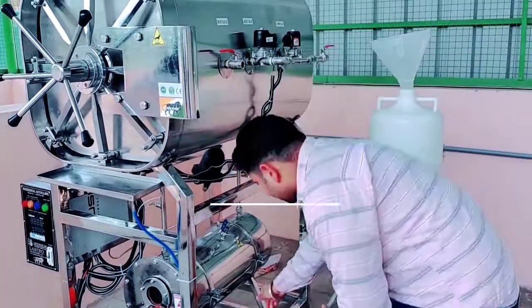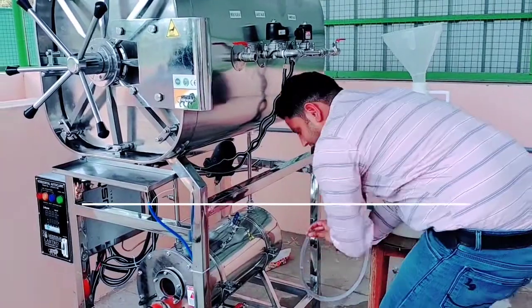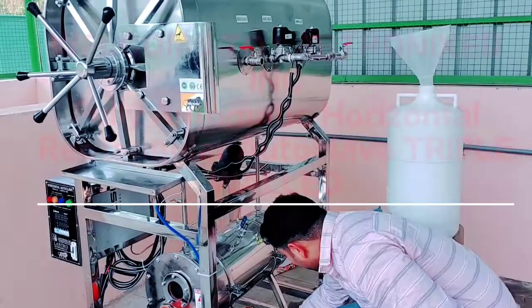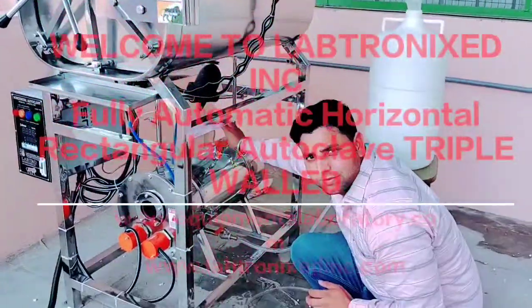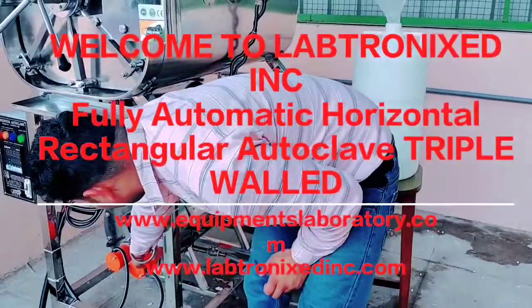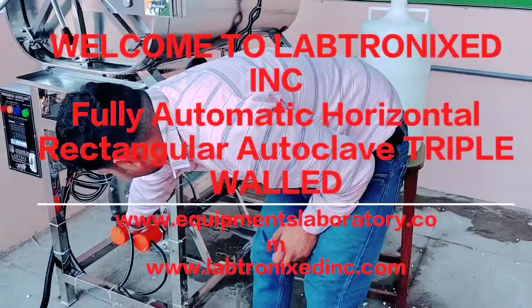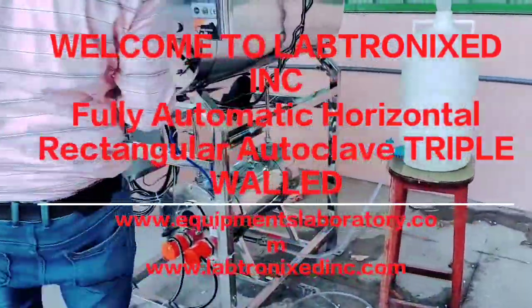Now we want to send the water, and this we connect here, and we will move this. Now water is filling and water level is coming here. This is the water level, you can check it. After that, you will open this.